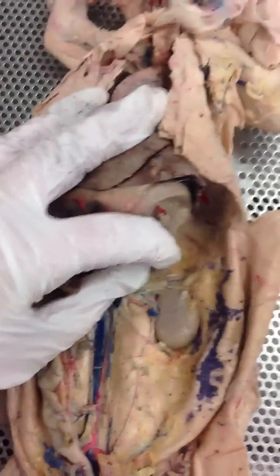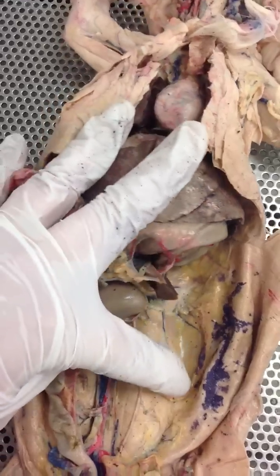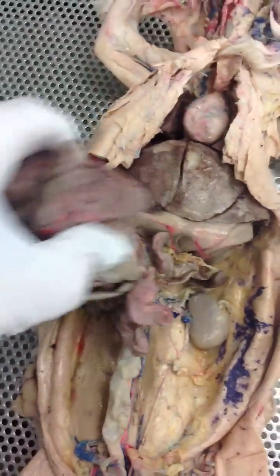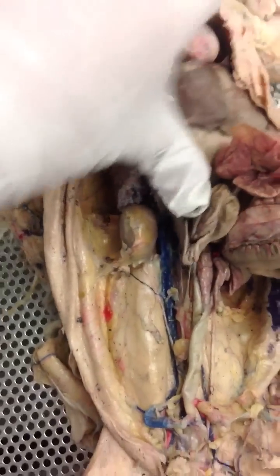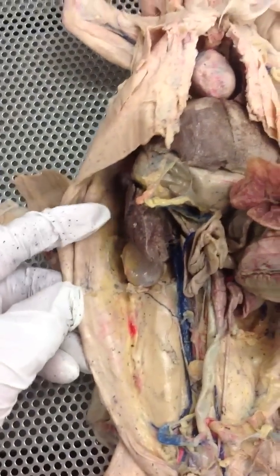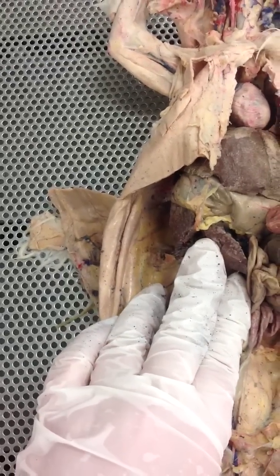The adrenal gland — let's see if we can find it in here. The yellow nodule right there in the rabbit, that's going to be your adrenal gland.